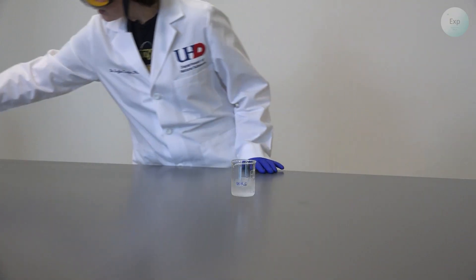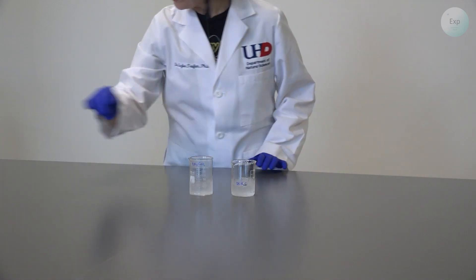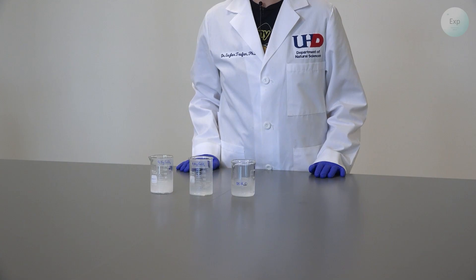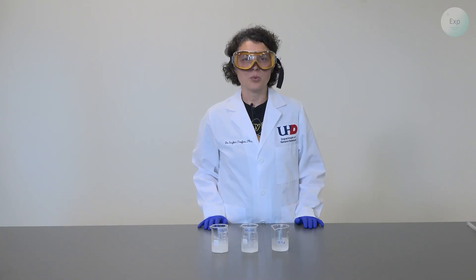I have all those beakers already made for my experiments that involved the freezing point depression and now we're going to look at the boiling point elevation.